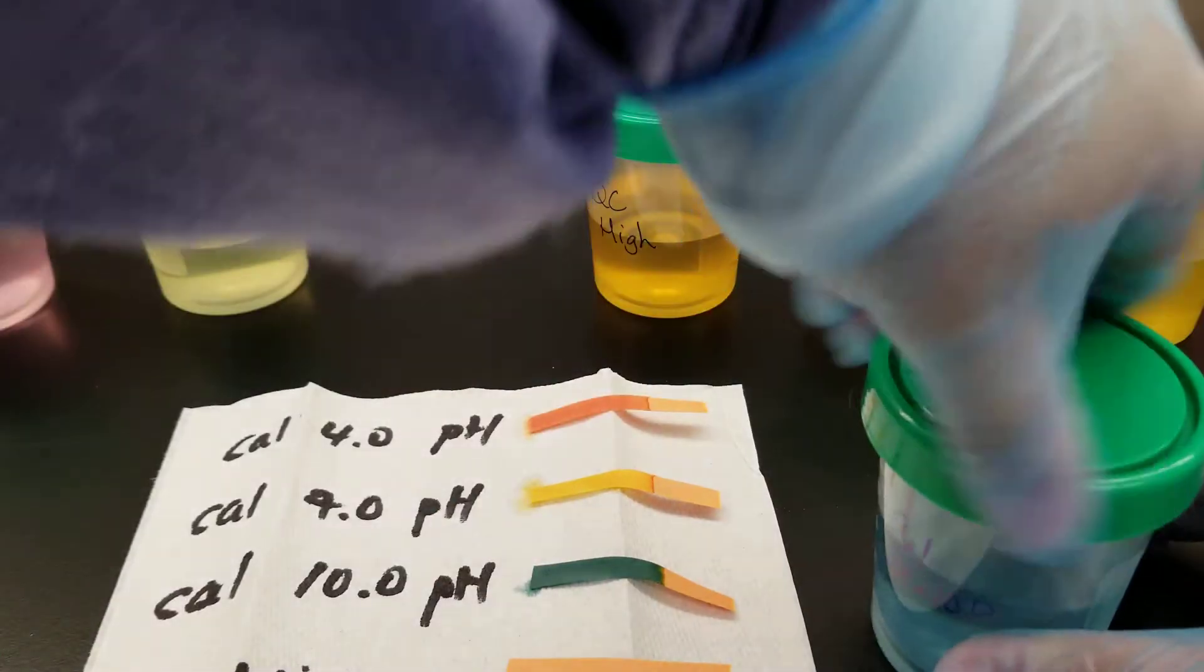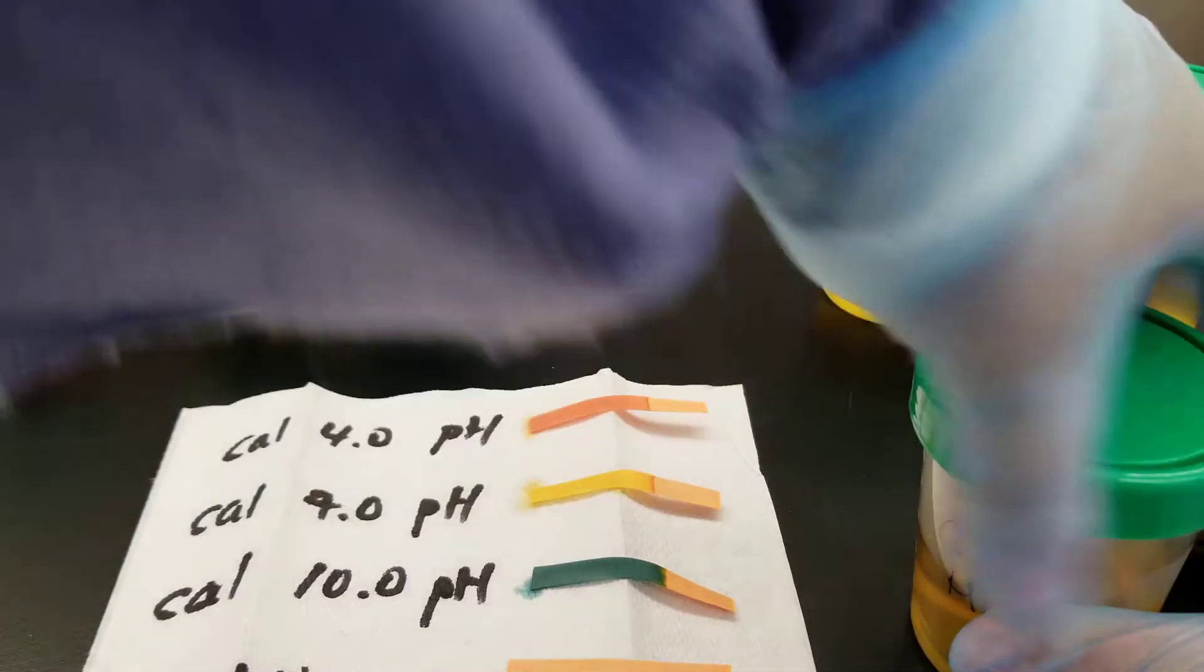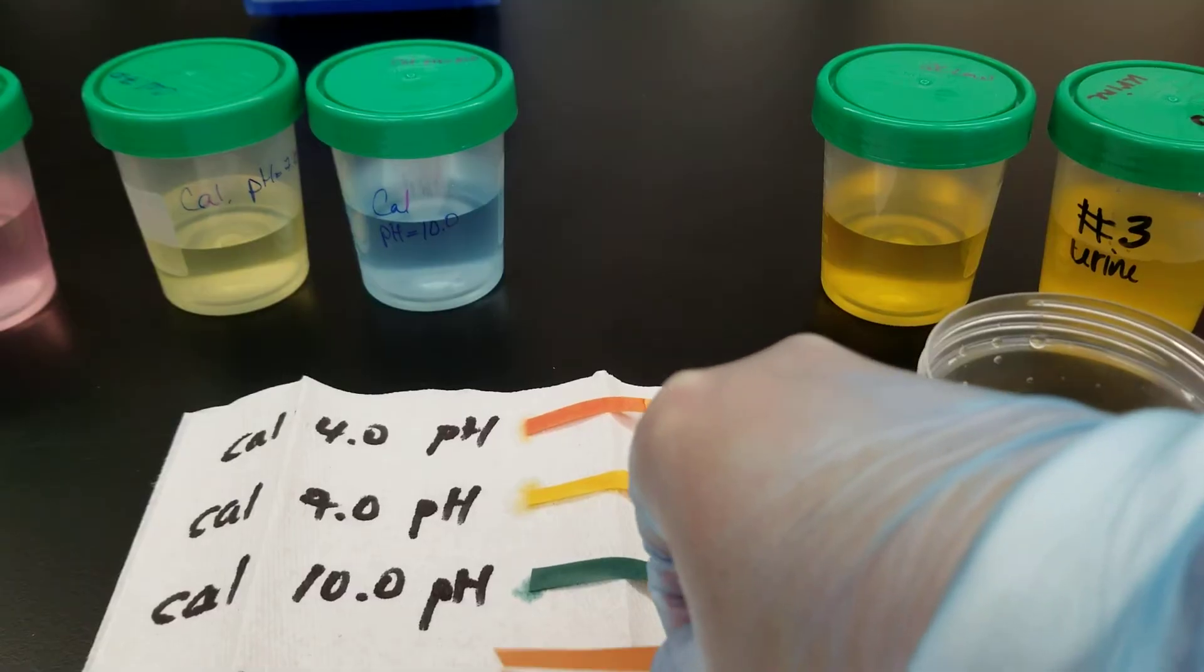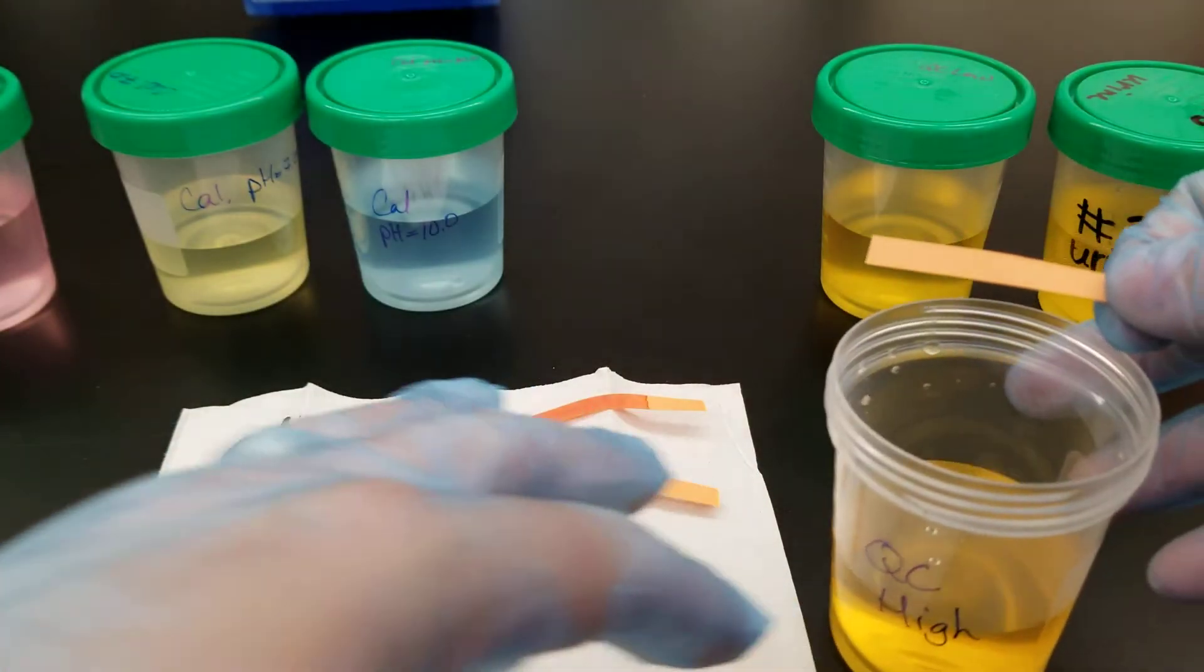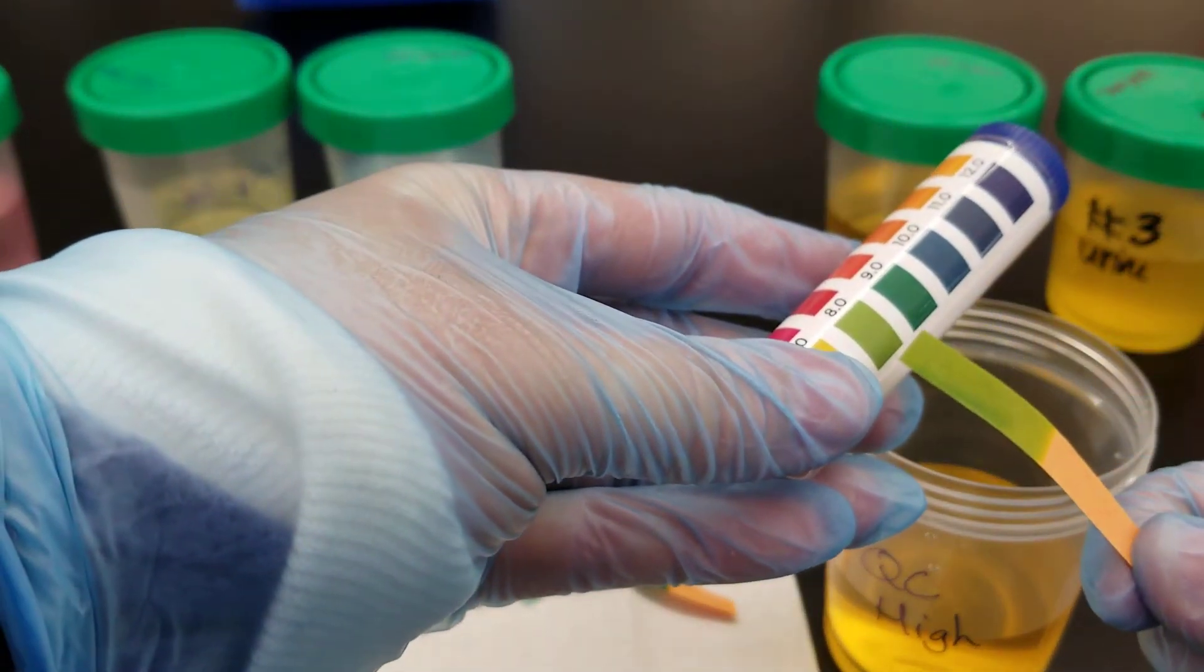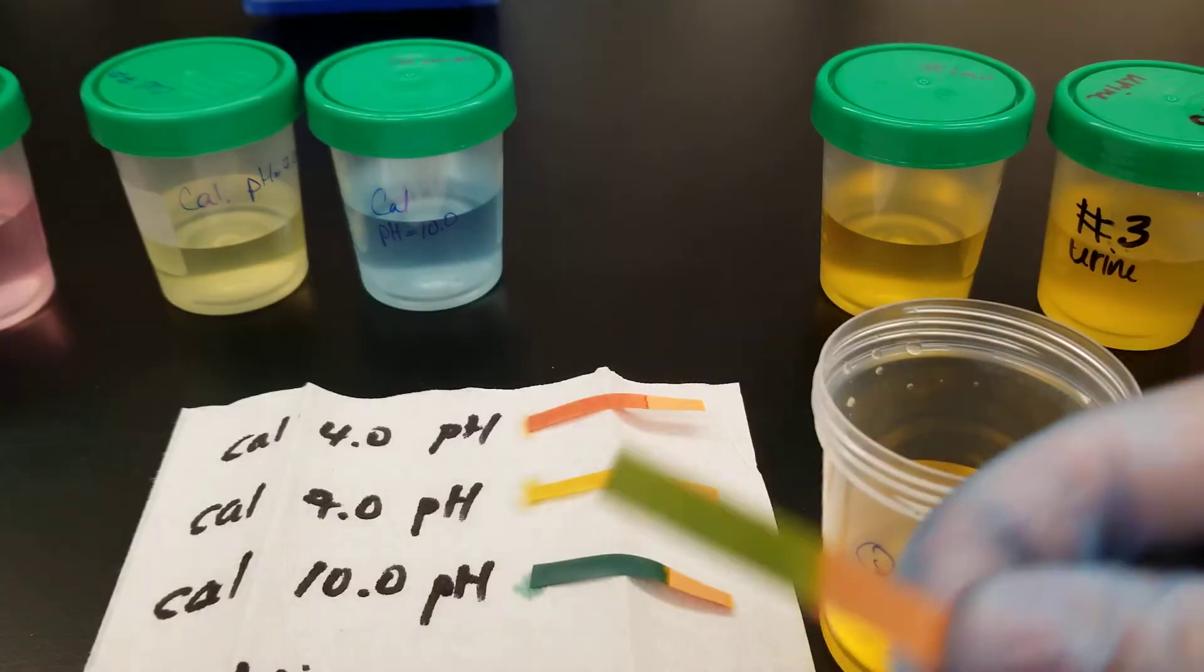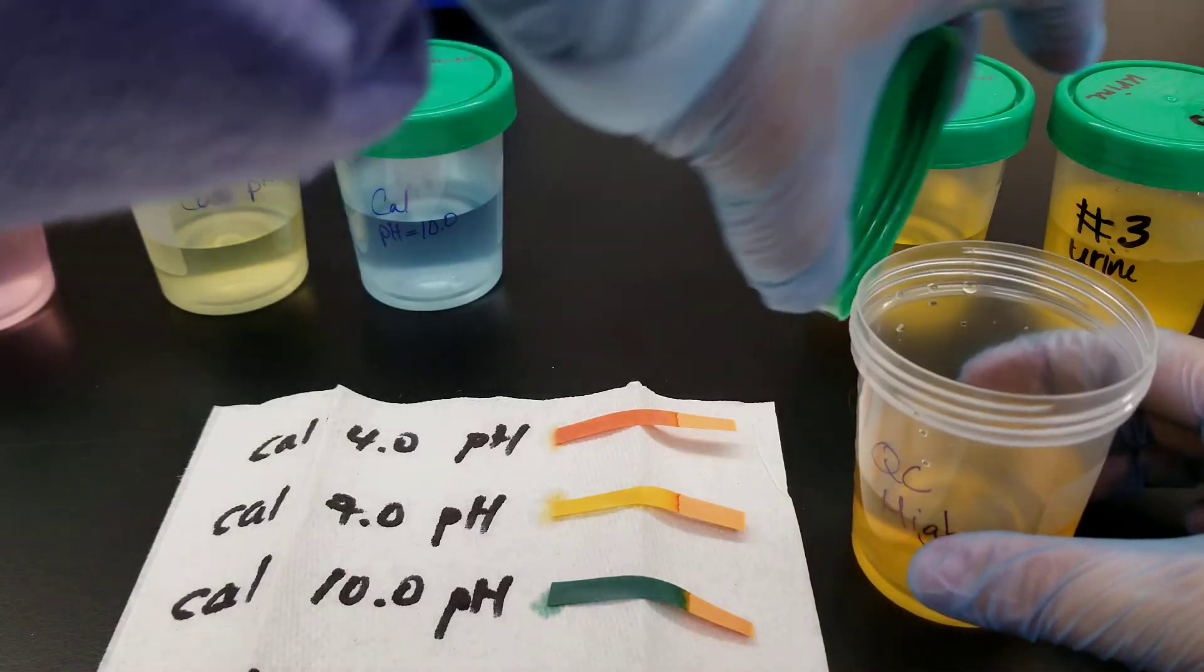Let's do high QC. Dip that. If you'll notice, I am getting rid of excess. So I dip and get rid of excess on the side lip. This looks like an 8.